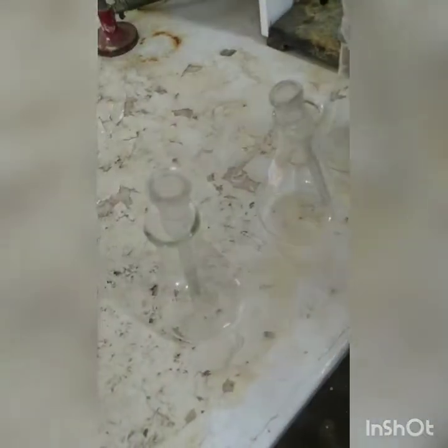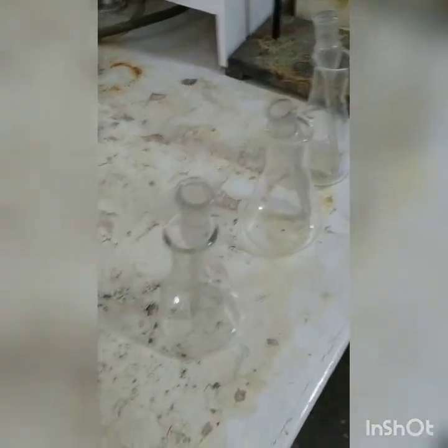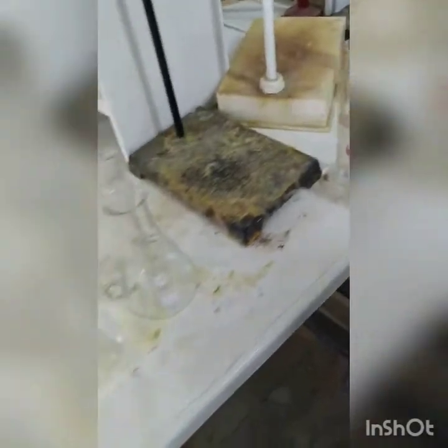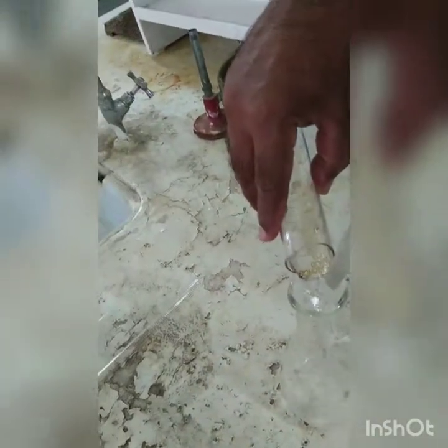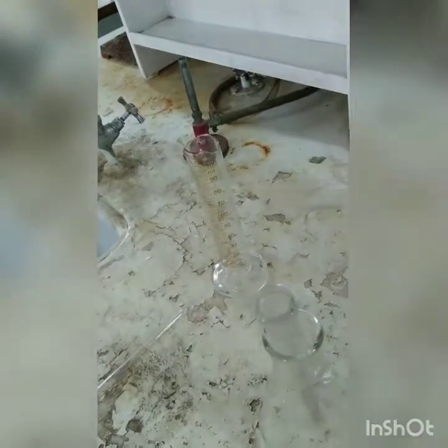Now this is the distillate collection assembly, and we will be collecting the distillate, 200 ml each, in this assembly, and for that we have to add 2% boric acid solution. So 50 ml of 2% boric acid solution will be added to each of these collecting flasks. We are going to dip this tube in that, so that the mouth is dipped in boric acid.